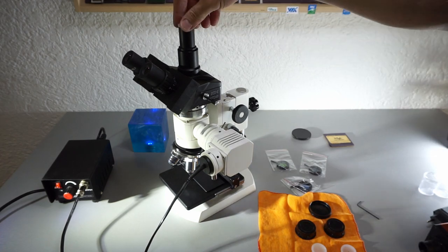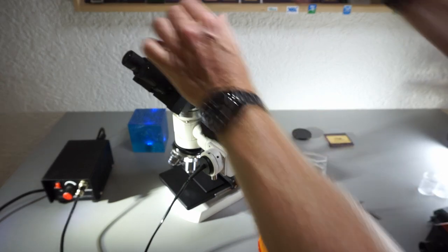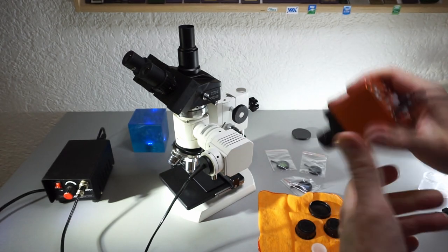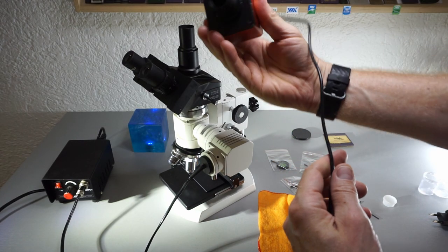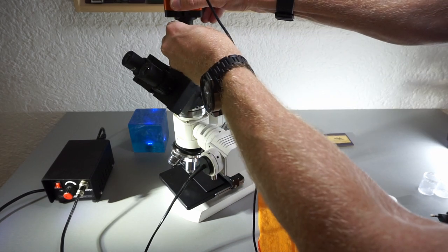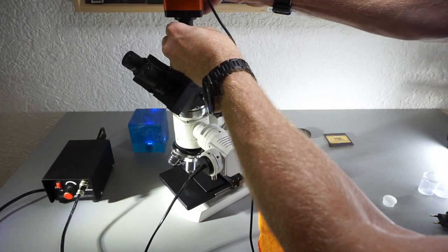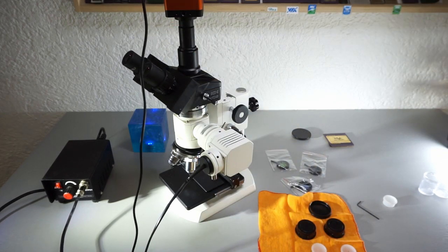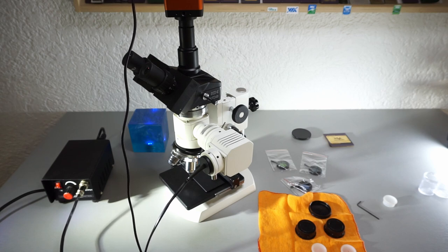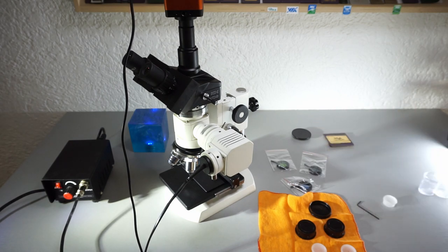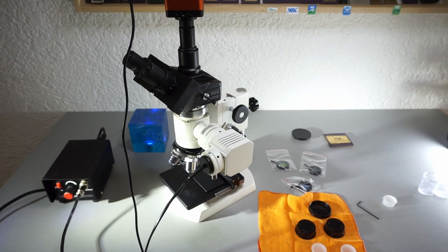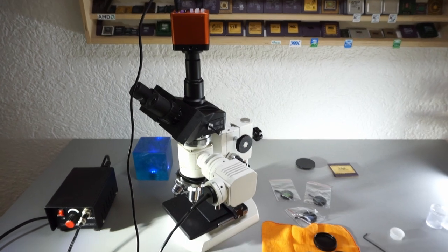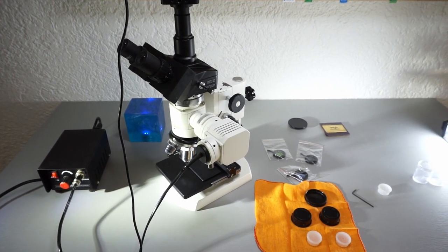Let's install the camera, which is a digital camera from third party. Just insert it here, power it up, and then either record on the chip or look at it directly using a screen. Yeah, so that's the whole setup so far.